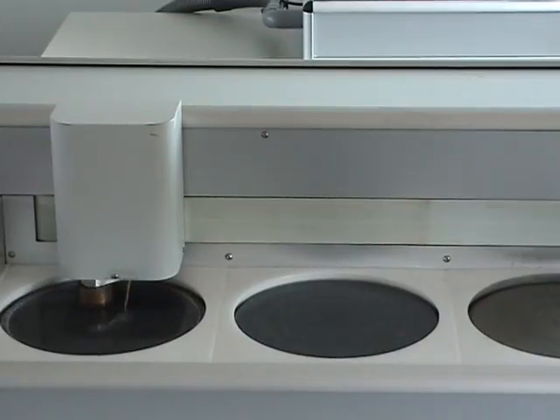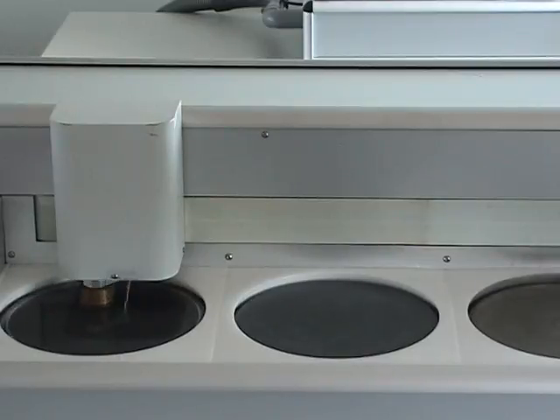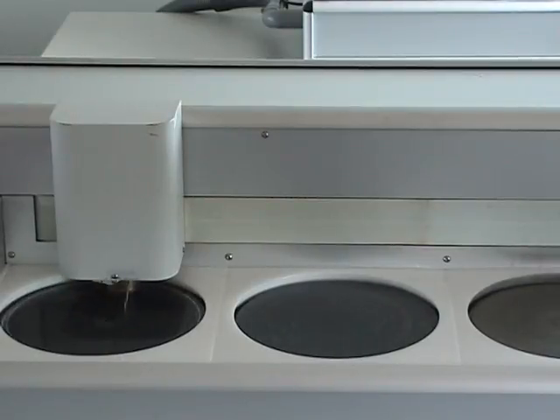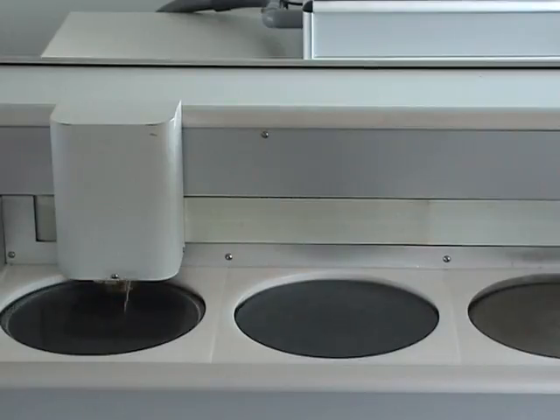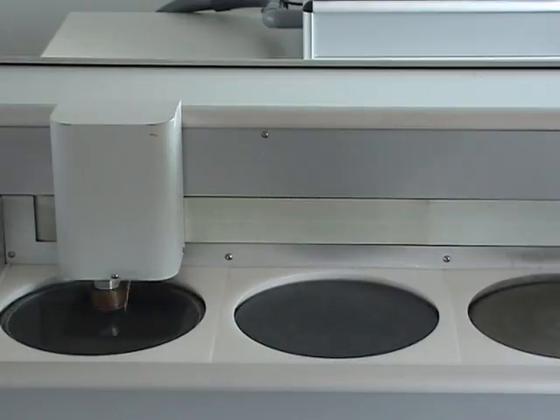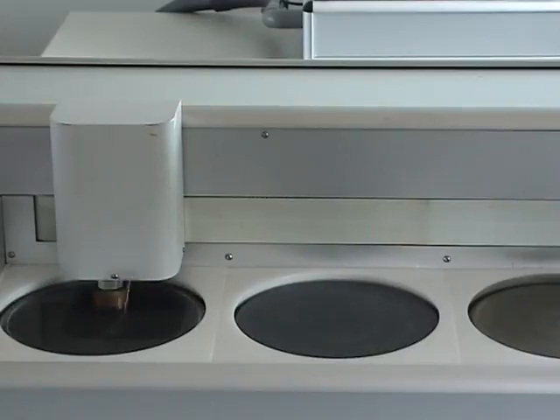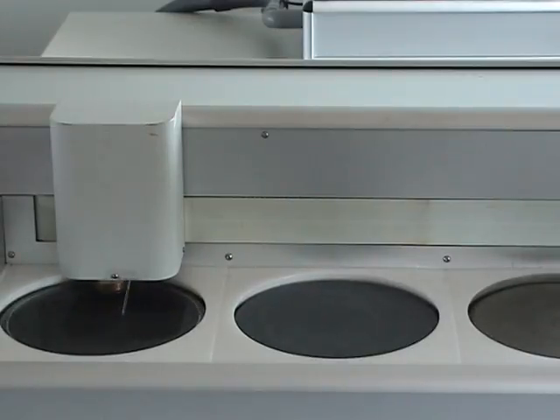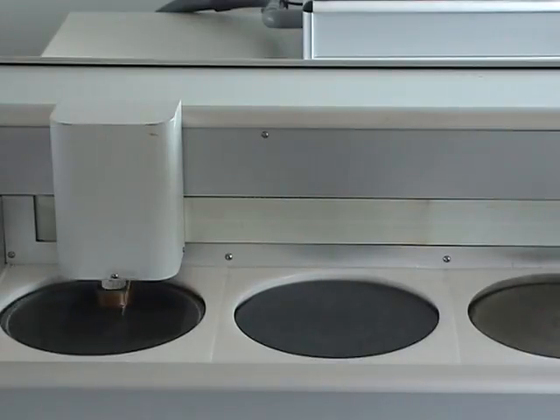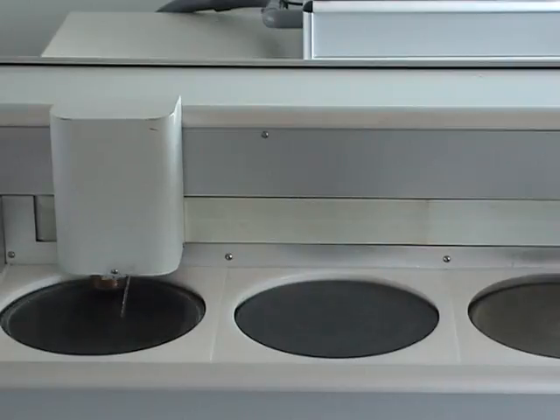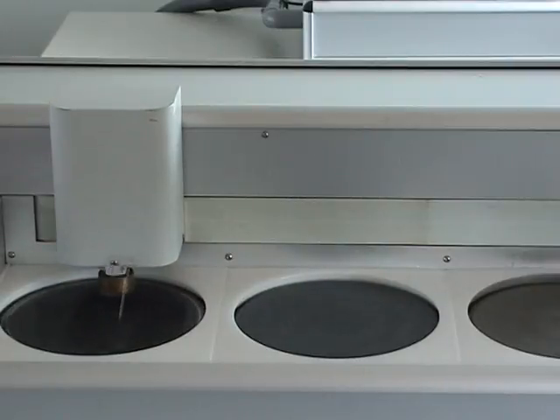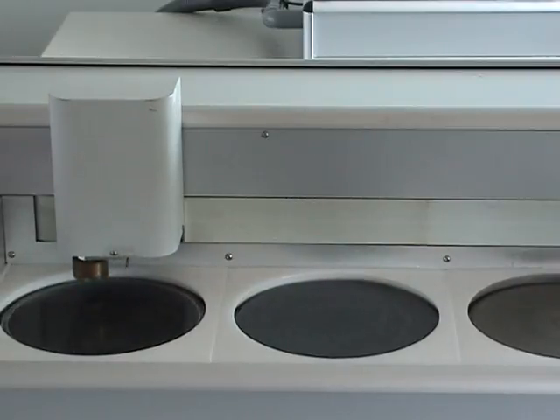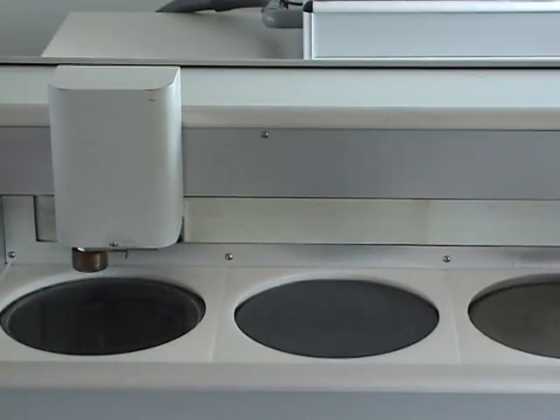The SPA machine is fully programmable, so you can program rough and fine grinding individually. The whole amount of grinding, rough and fine, is exactly the number which was programmed as offset in the TSM sawing process.